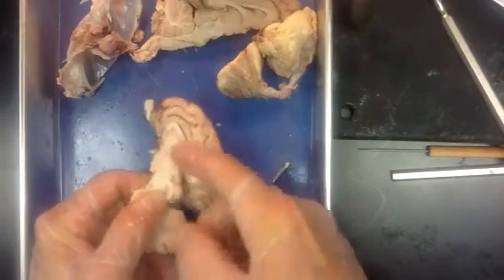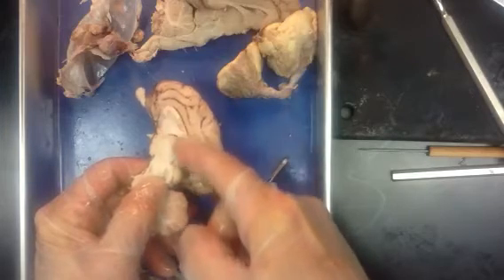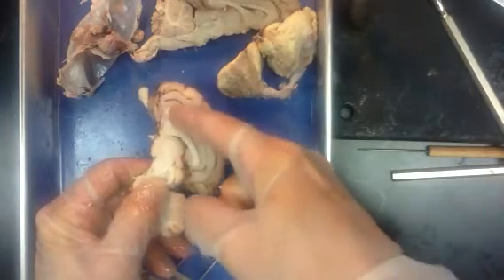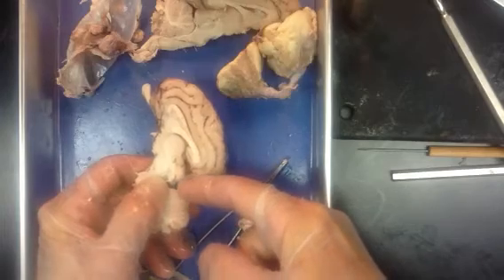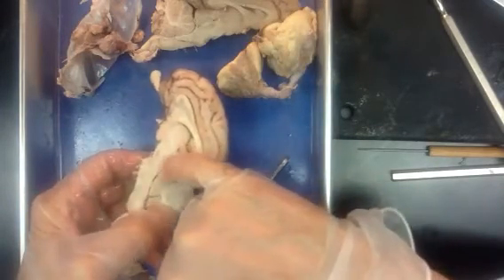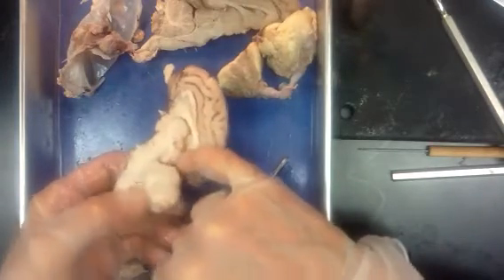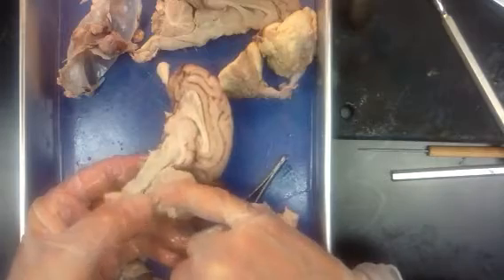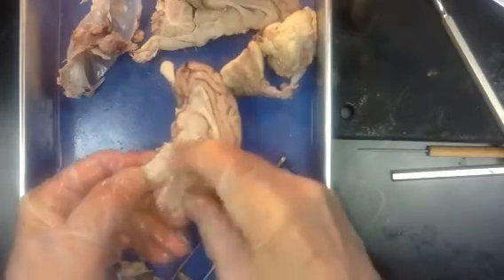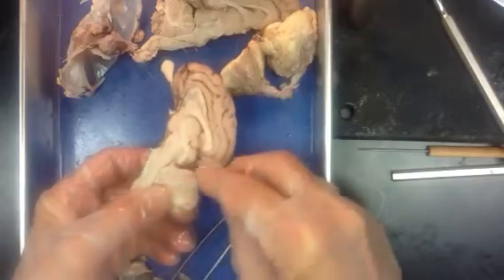So we have a ventricle here. We have 4 ventricles. There are 2 lateral ones that sit under this corpus callosum here, this white-colored C structure. And then there's a 3rd ventricle that comes down this little space in here just above the cerebellum. And then there's a 4th one right in here where the cerebellum is right next to the spinal cord, across from the pons.